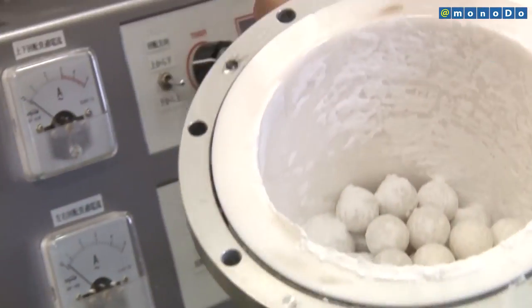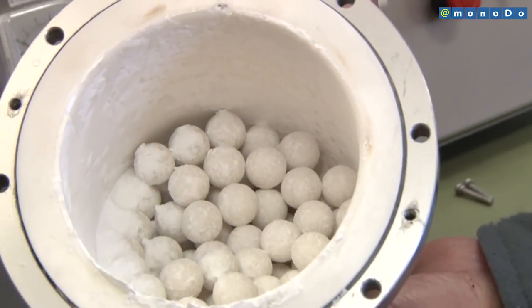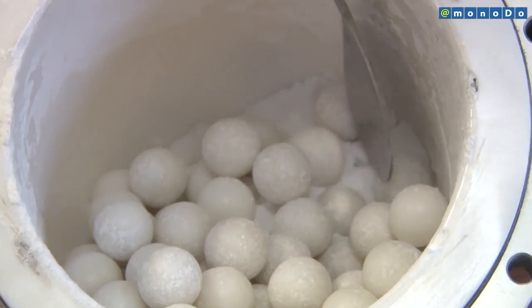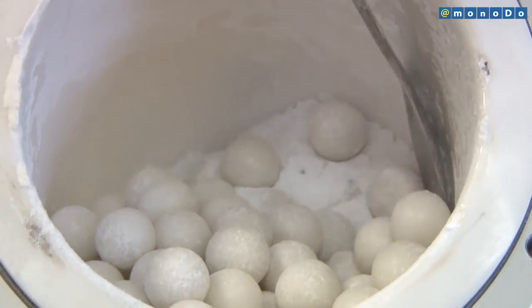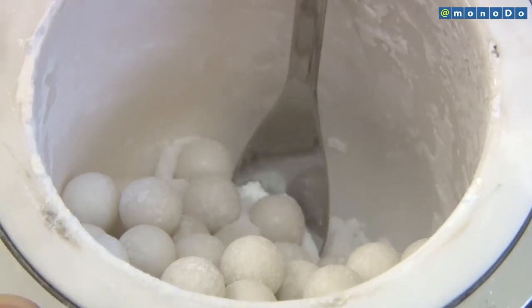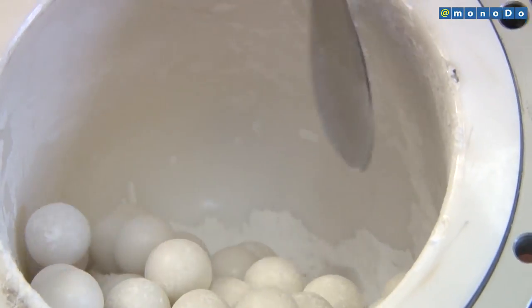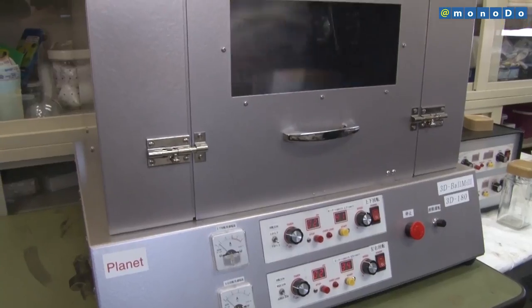Because the 3D ball mill container moves in its entirety, heat is dispersed, making it difficult to reach high temperatures. Thus this is favorable for pulverizing as well as distributing and mixing material not particularly resistant to heat, such as organic material.